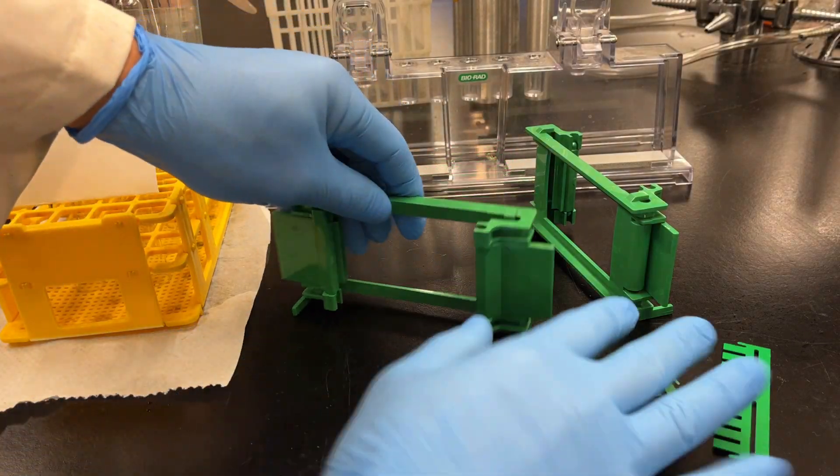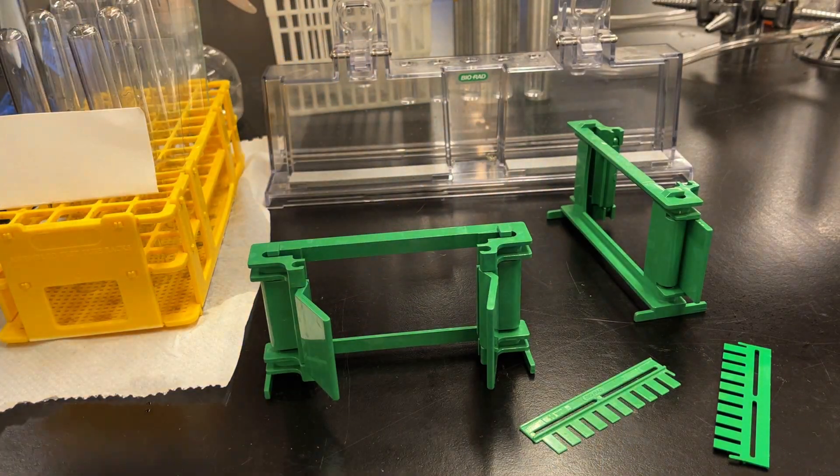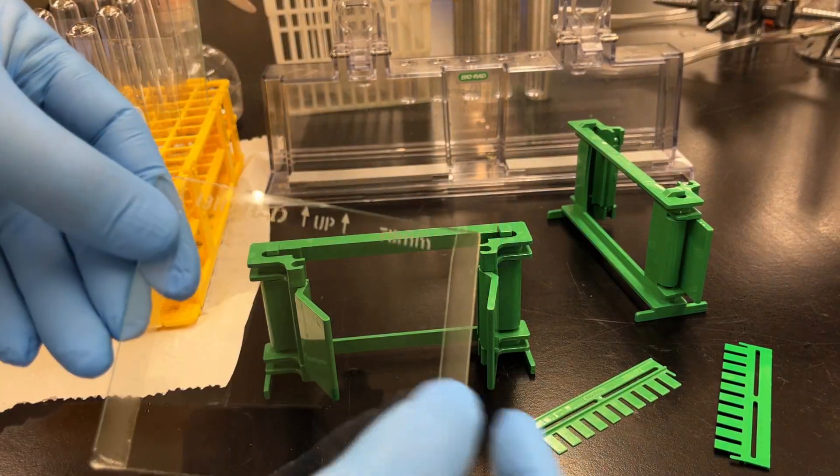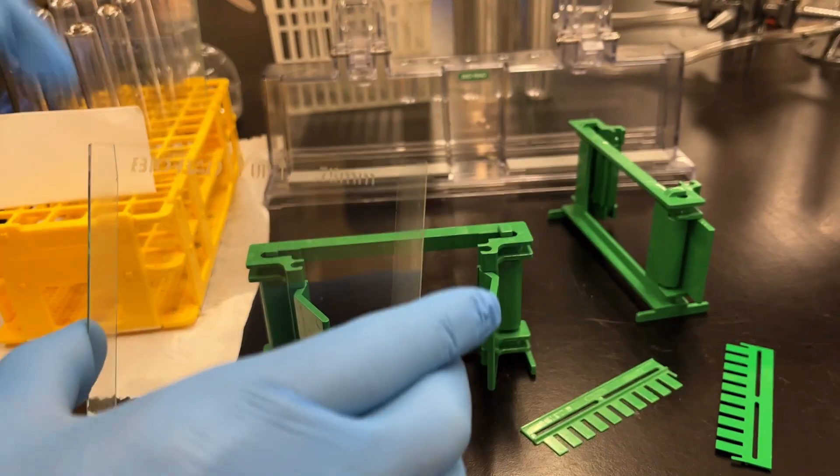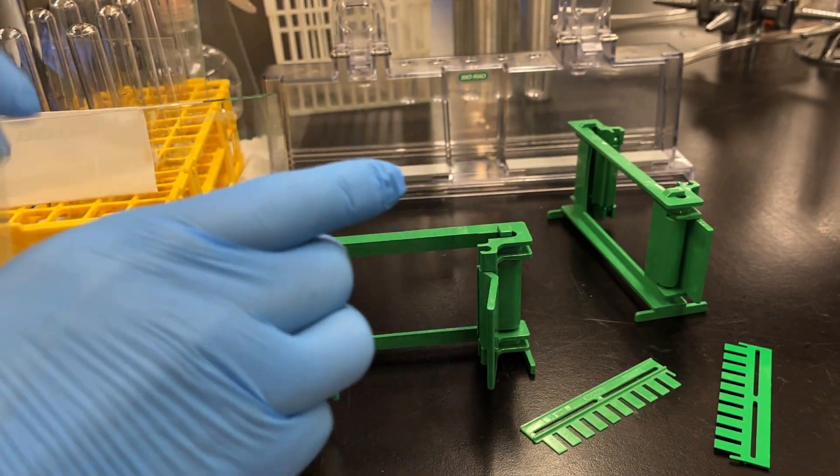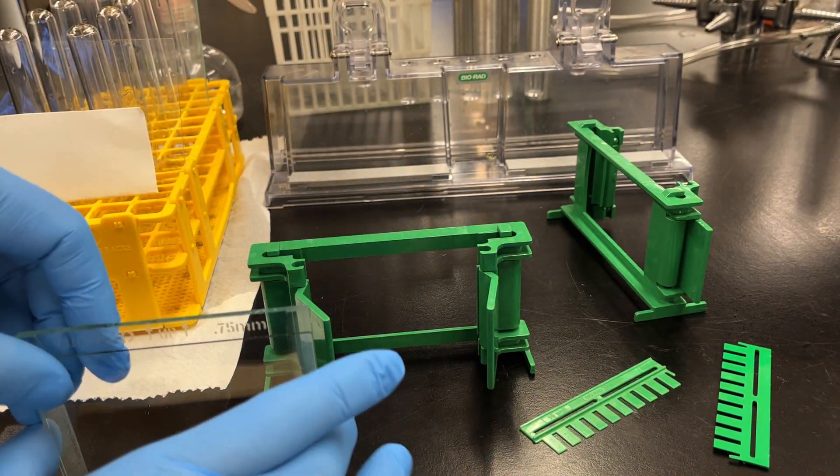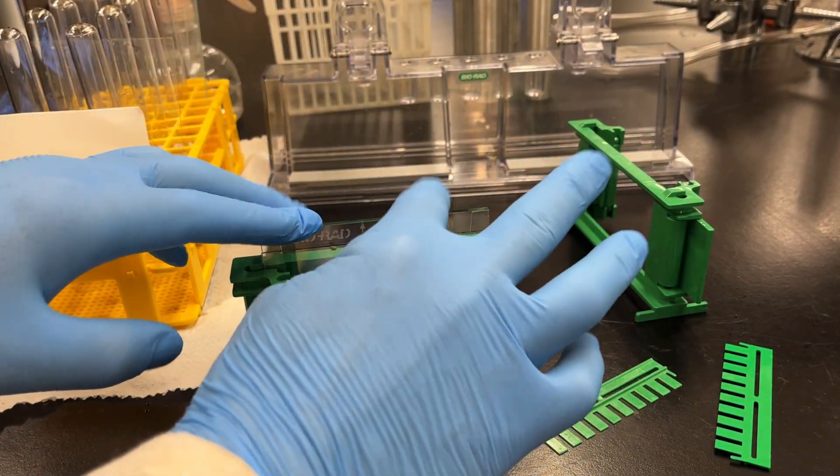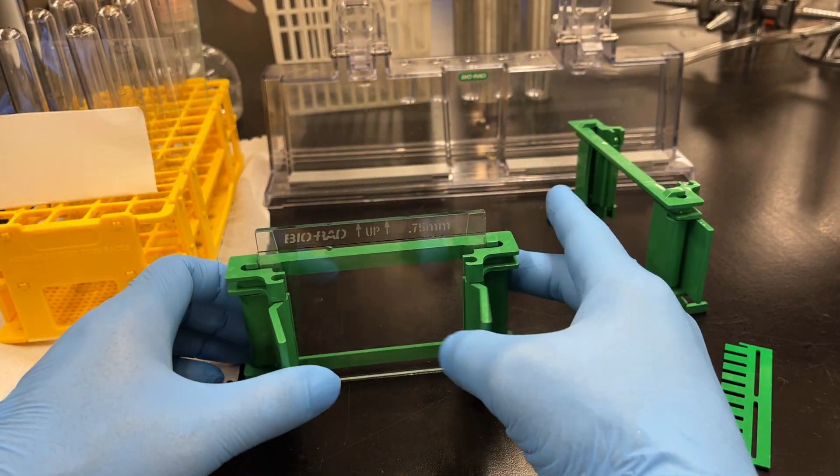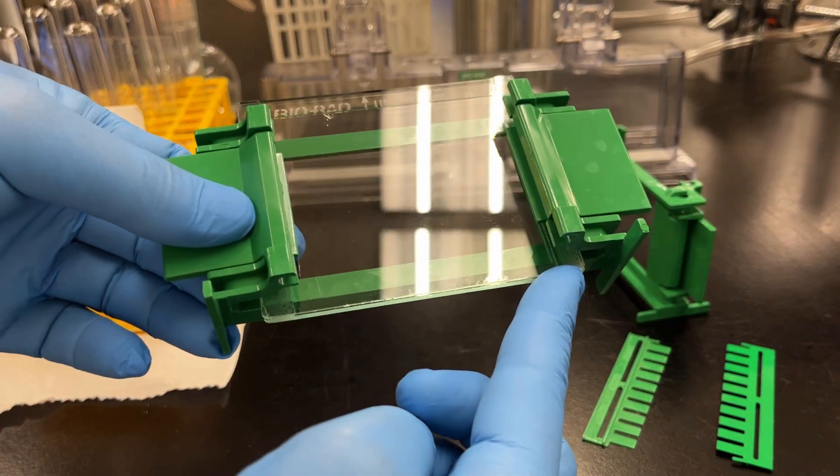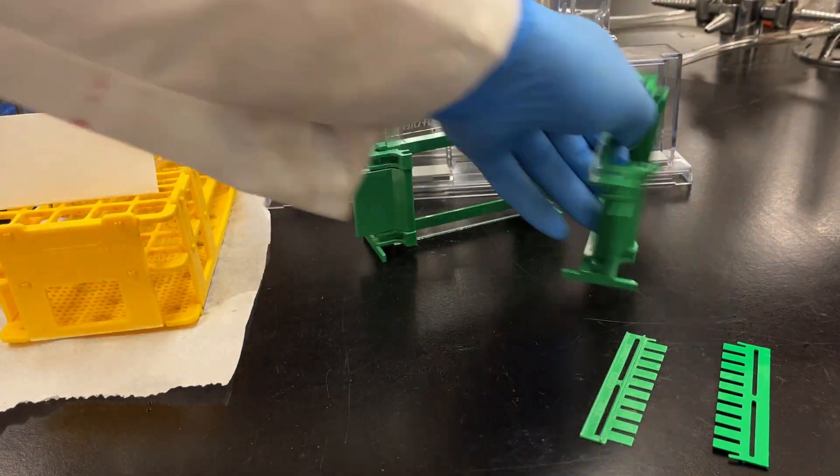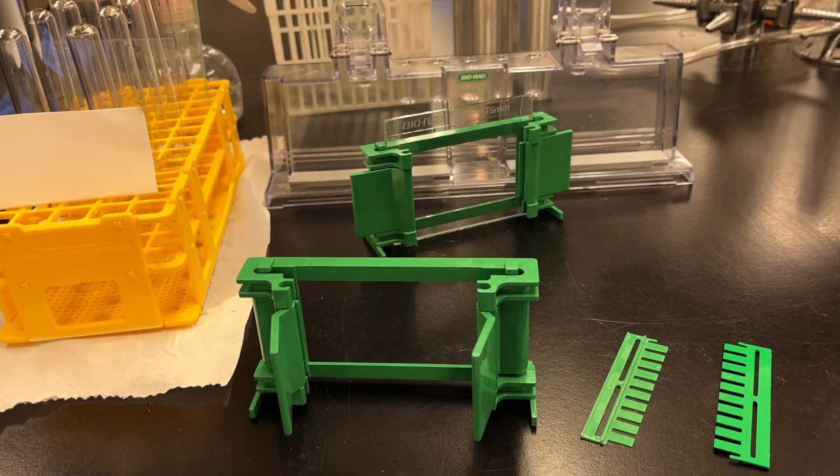When using the glass plate clamps, make sure that the feet are on the bottom, then open the clamps. Remember, the labels are facing you, the upside is up. The other way to do that is make sure that the small glass plate sits on that ridge. I like to use a flat surface so the benches are great, and then simply clamp it closed. Make sure that the edges of each of the plates are even, otherwise you're going to get leakage. Repeat for the second gel.